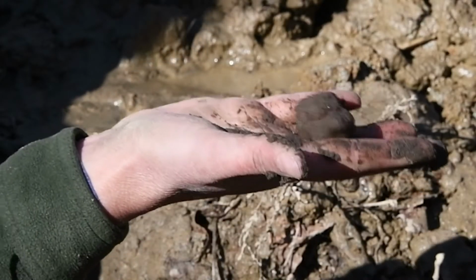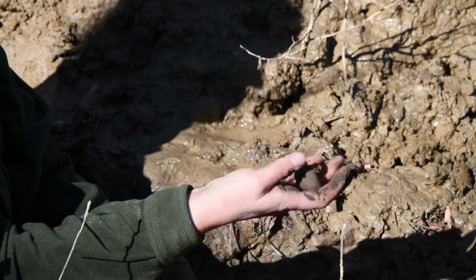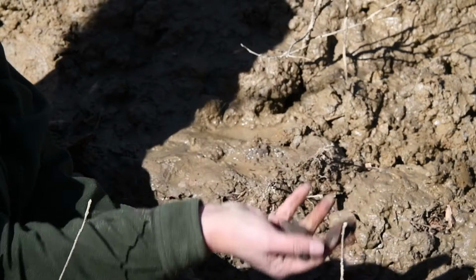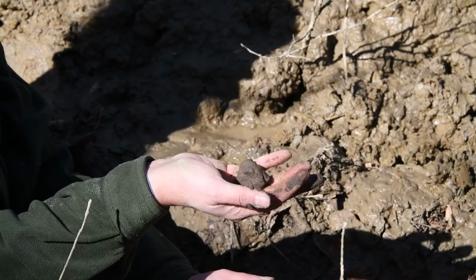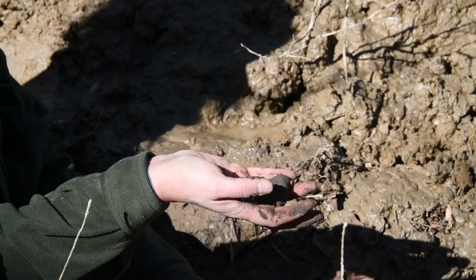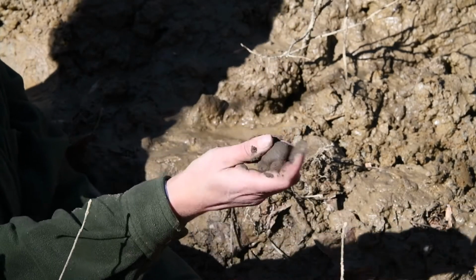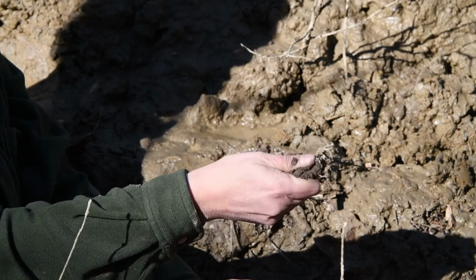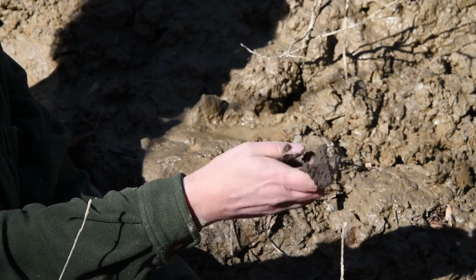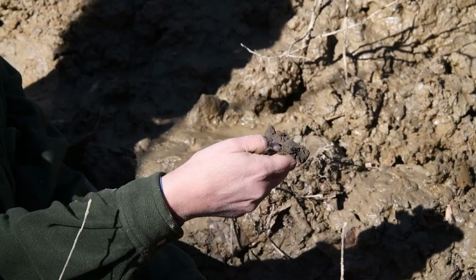So what we're left with is, is it loamy clay or is it sandy? To determine that, you want to form a ball. If you kind of toss it in your fingers or in your hand, if it falls apart, it's sandy. If it stays together, then it's loamy clay. The other thing you can do is push it between your finger and your thumb, and if it actually holds together in a ribbon, it's loamy clay. If it just falls apart, falls right off your finger as you're pushing it out, then it's sandy.